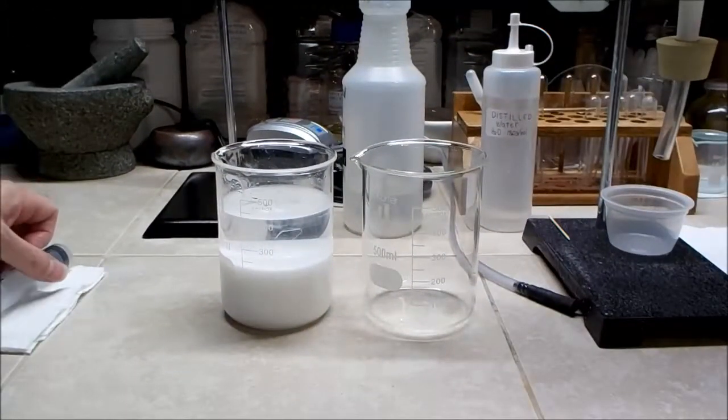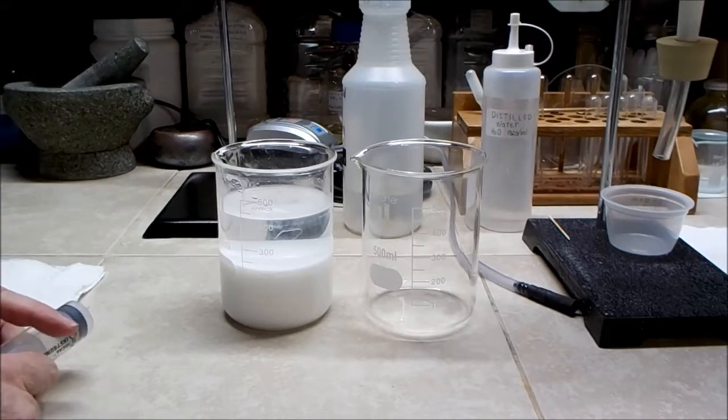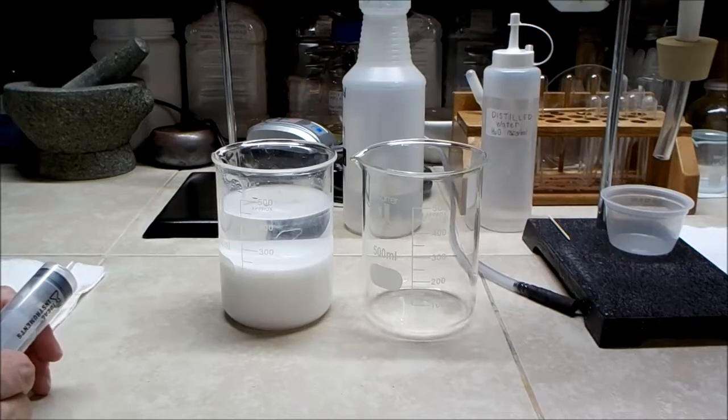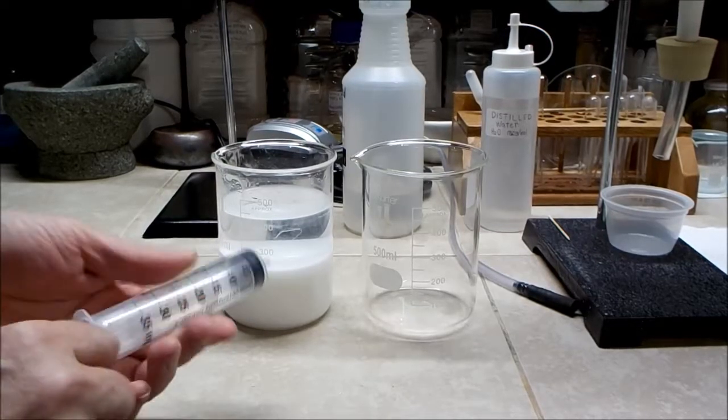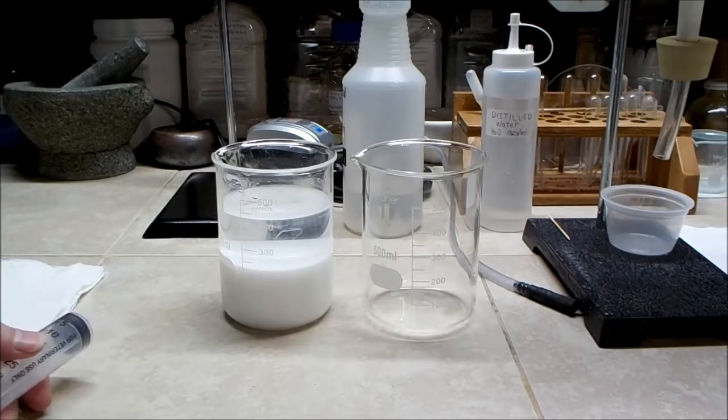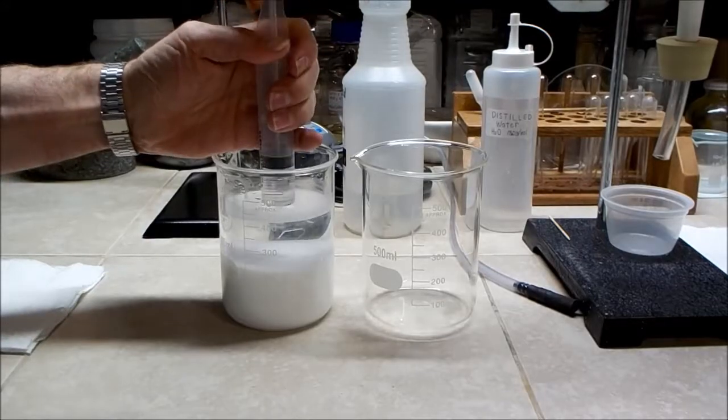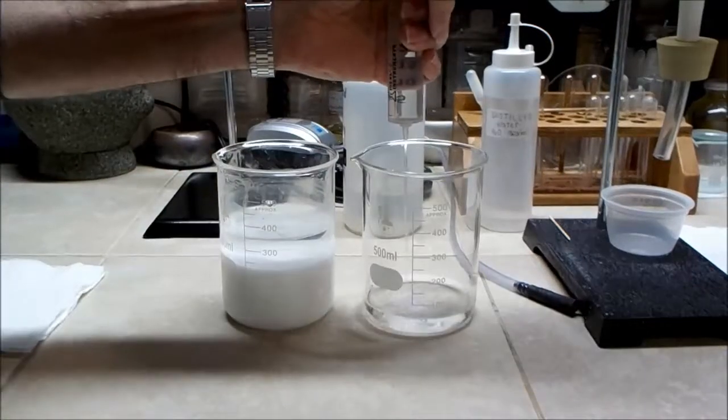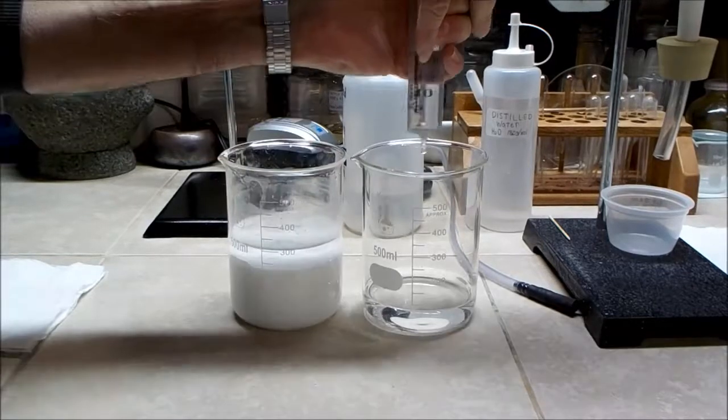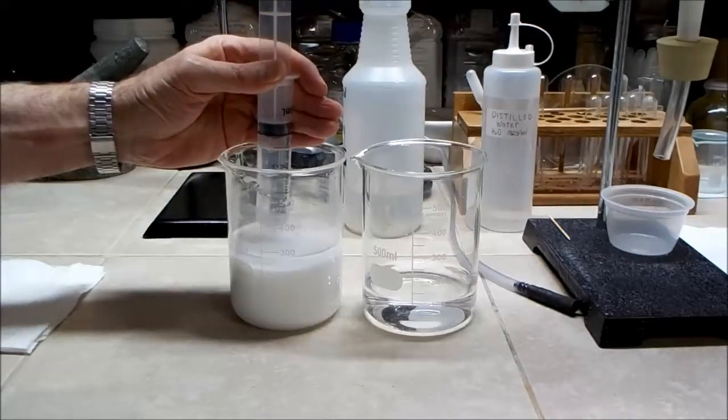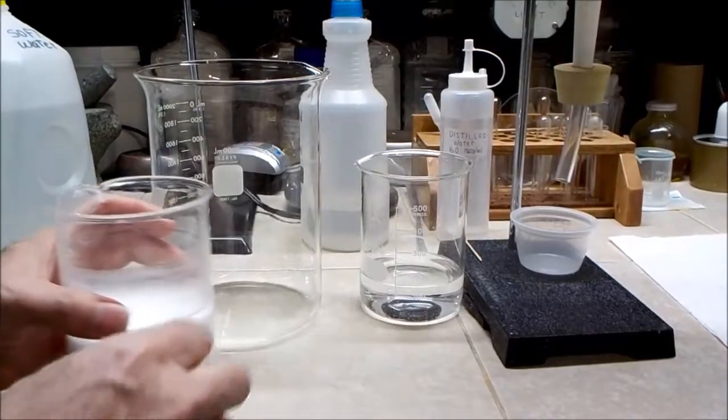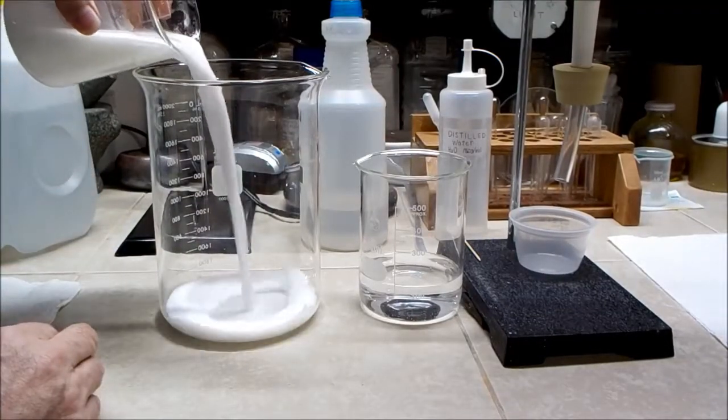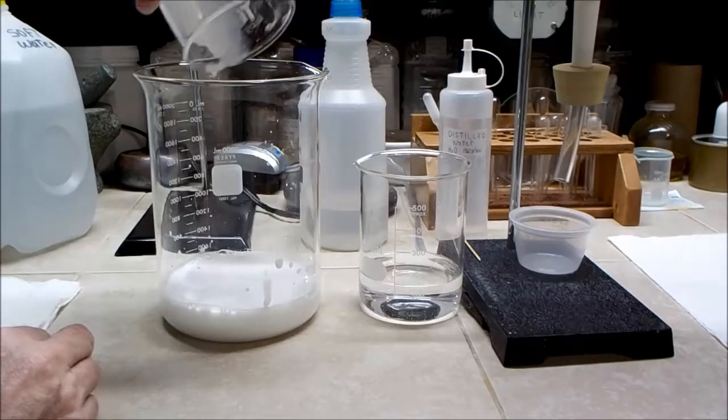All right, so this was plan C. So after sitting in the beaker for about three hours, it settled down that far. Decantation probably even going to be a problem, so I'm going to try and use this syringe to withdraw the upper part of this solution. Okay, so I think the solution is diluted with lots of water, otherwise this process is going to take way too long. There goes the stir bar.